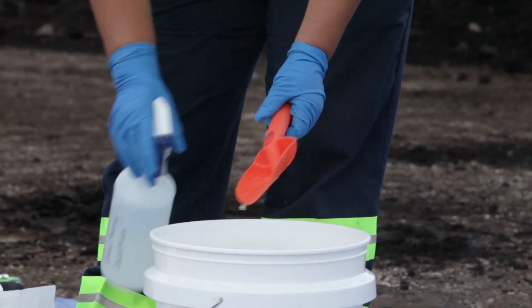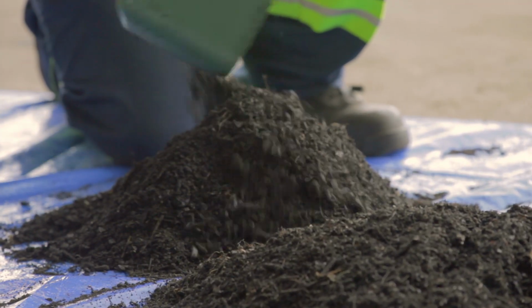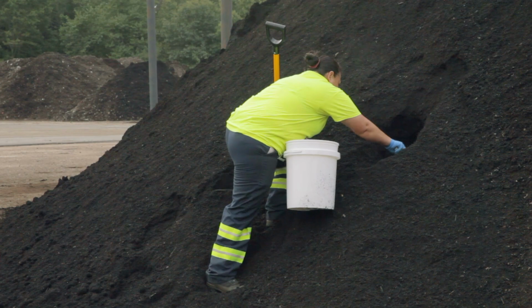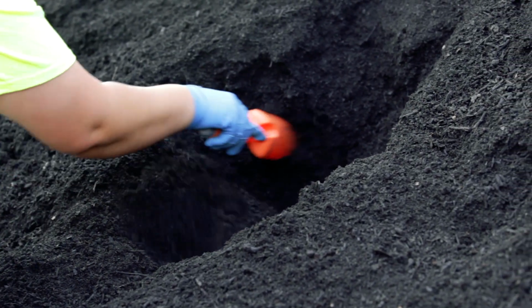Plastic hand trowels and buckets, along with blending on a plastic tarp, should avoid introducing additional metals. Stainless steel trowels, spoons, and bowls could also be used and are better to use if also analyzing the compost for parameters for which plastic equipment may confound the results. It should be noted that galvanized metal equipment should not be used as it can introduce additional zinc. If using a shovel to dig to the depth of the subsample, scrape away the area that has contacted the shovel blade prior to collecting the subsample with a hand trowel.